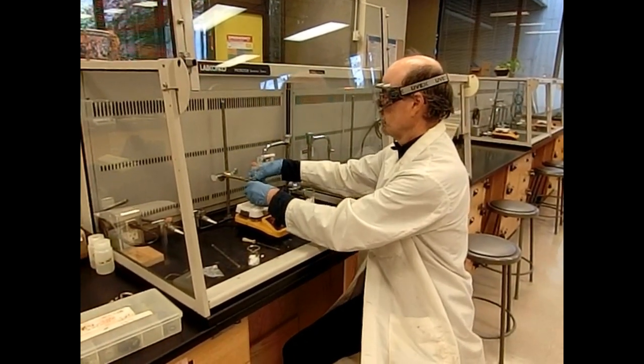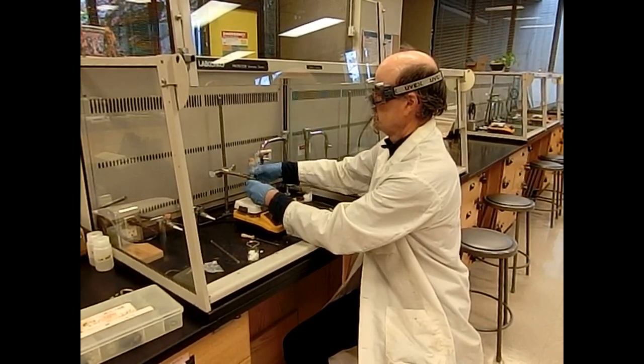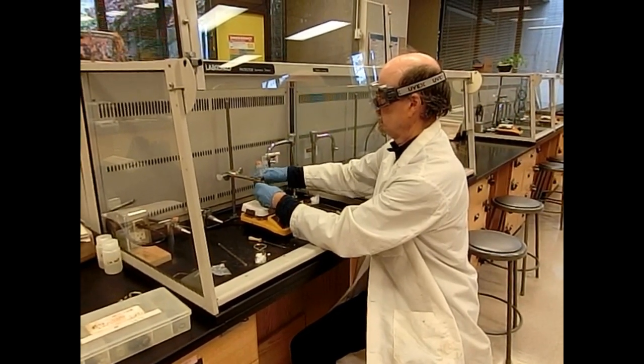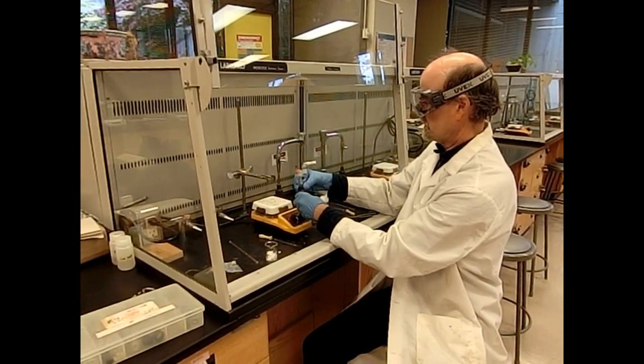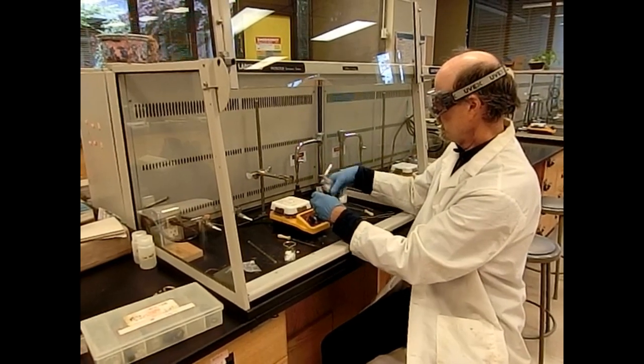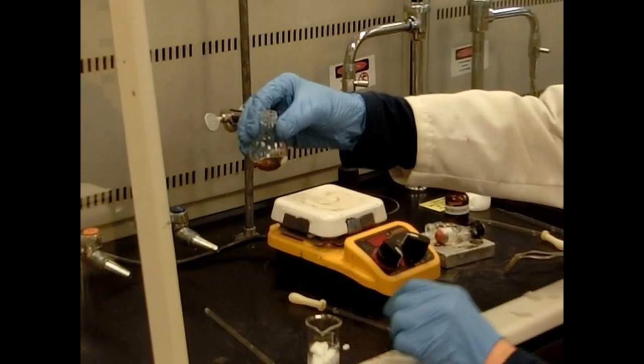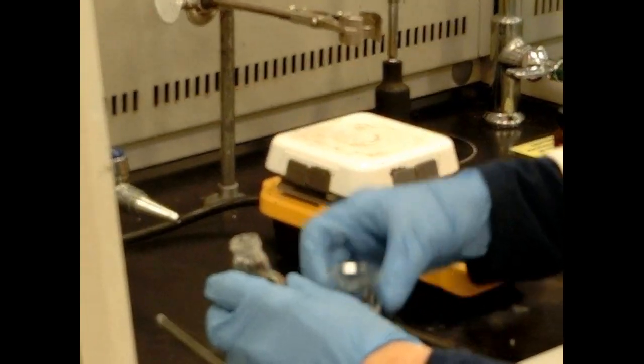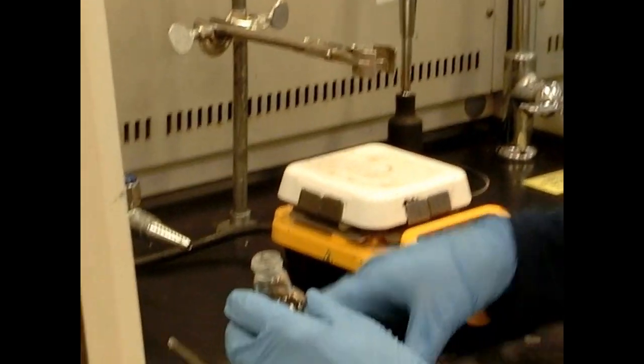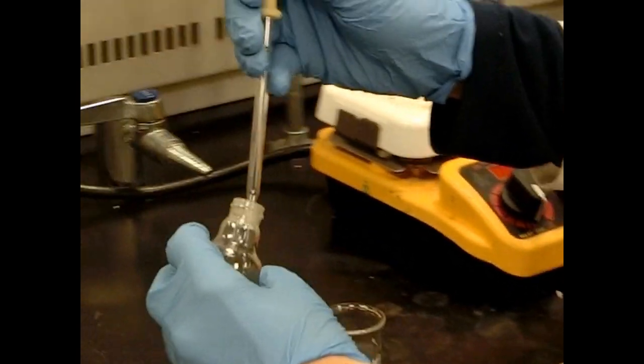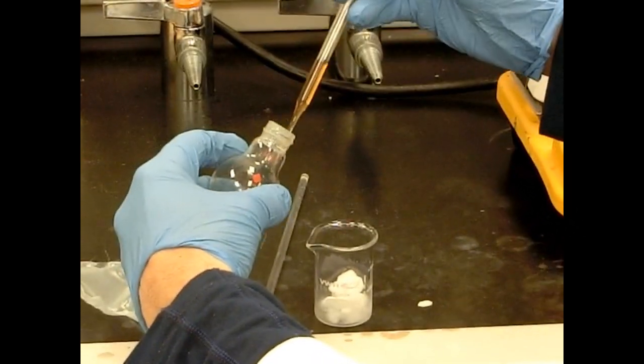All right, now we're ready to pour over dry ice our reaction. We did pretty well with this. Now the next step will be to pour this over dry ice. This is the CO2 for step two, and we'll get our step two reaction. So now I've got my Grignard solution. Nice dark brown solution. I'm going to add this to - this is dry ice. And it's in solid form. It's CO2. And this reaction takes place immediately. I'll just pipe that in, our nice Grignard solution.